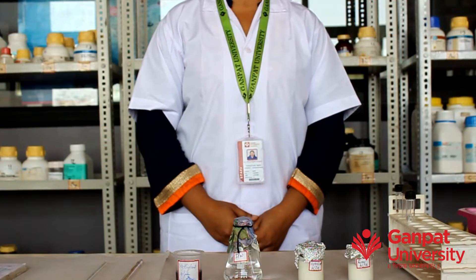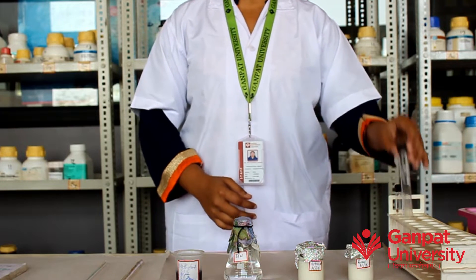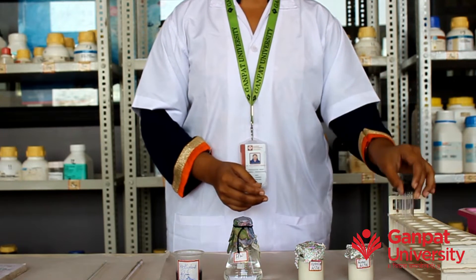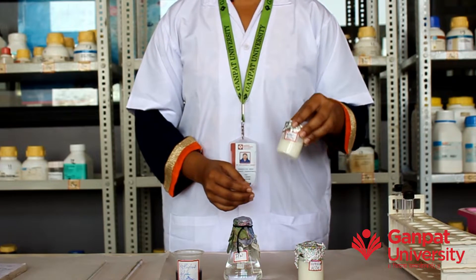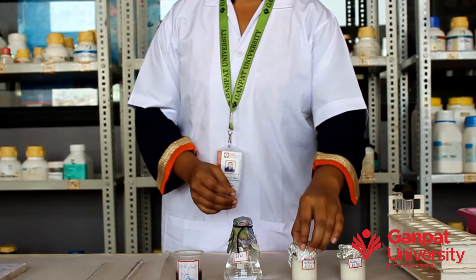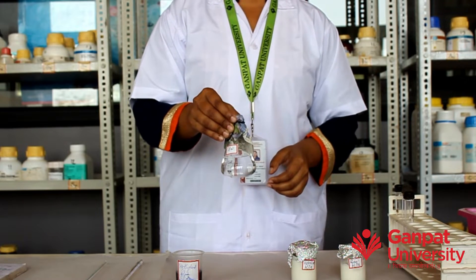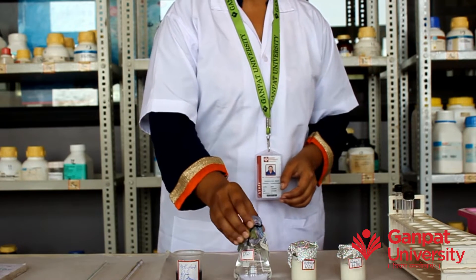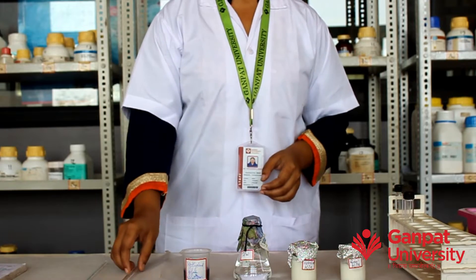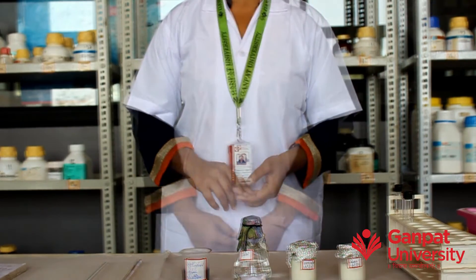For the MBRT test we need: a blue cap bottle, 10 ml tubes, milk samples — both pasteurized milk and raw milk — distilled water, methylene blue dye, and sterile 10 ml and 1 ml pipettes.